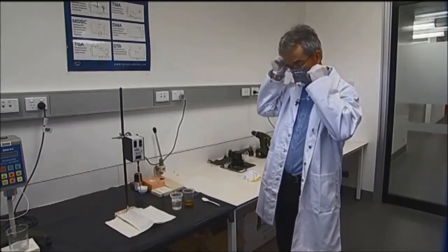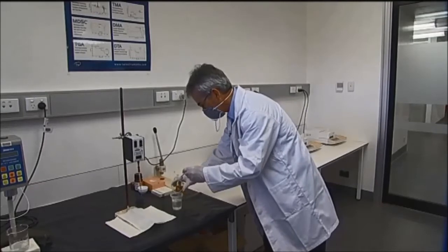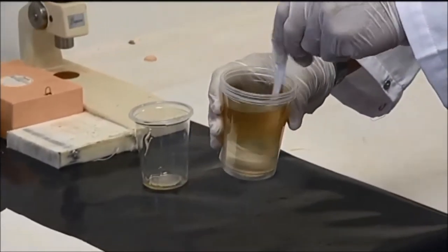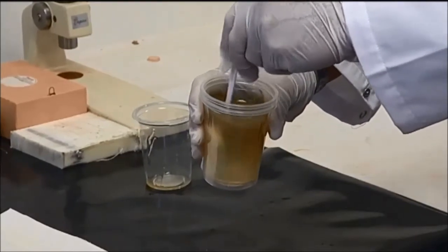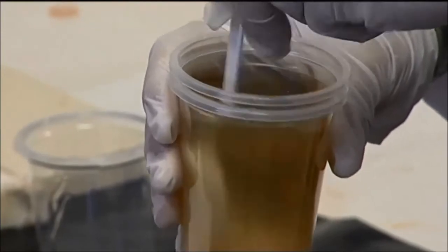In this case, we just start the test. The mixing of part A and the hardener part B of the epoxy resin should be done for about two minutes before proceeding to measure the gel time of the mixed epoxy resin.